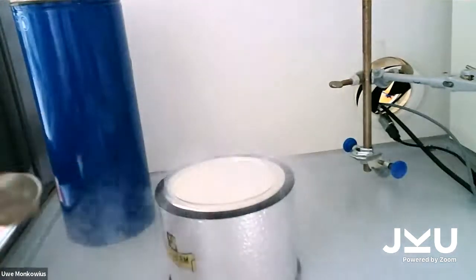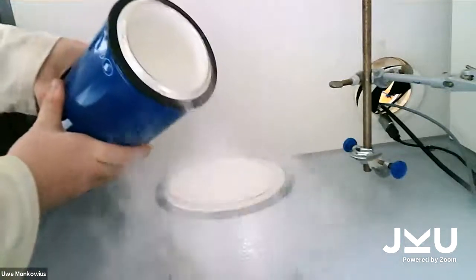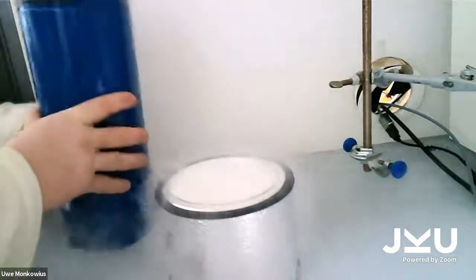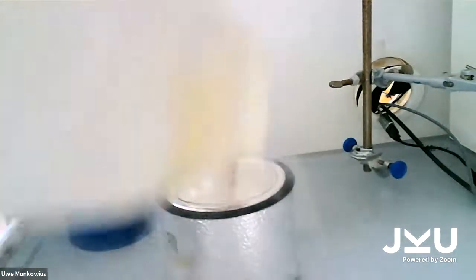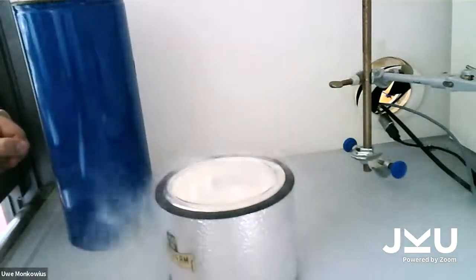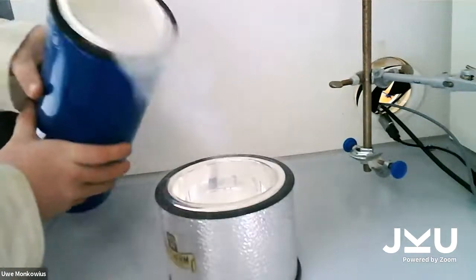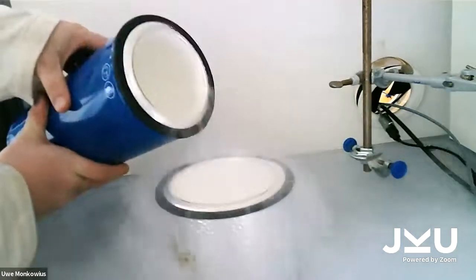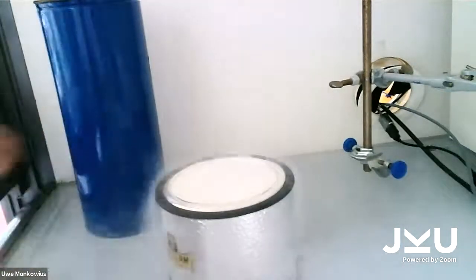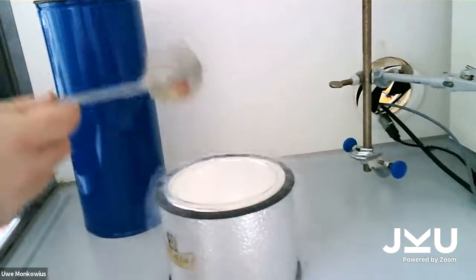Now, liquid nitrogen is really cold, like minus 200 degrees approximately. But it's still not that dangerous. Why? Because it's so cold that when I put my finger into it, the liquid nitrogen immediately evaporates and the cold doesn't really touch my finger. But please don't try to get anything into some cavity or something, because that would be really dangerous.